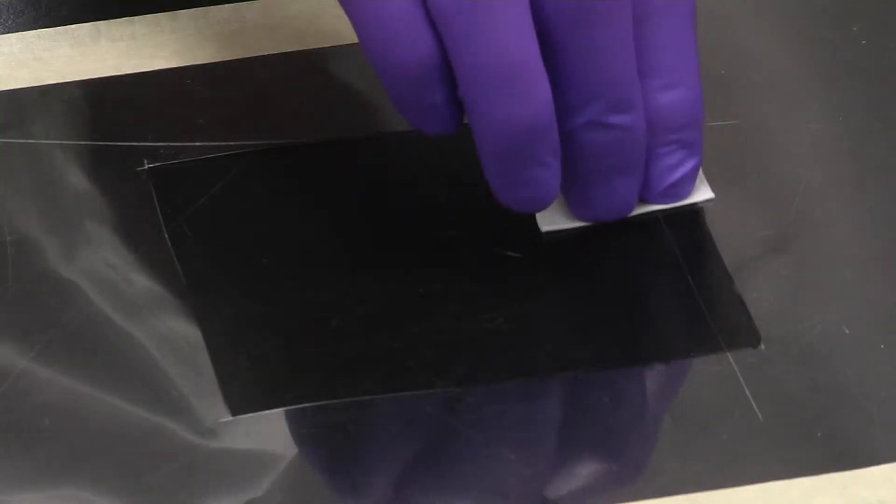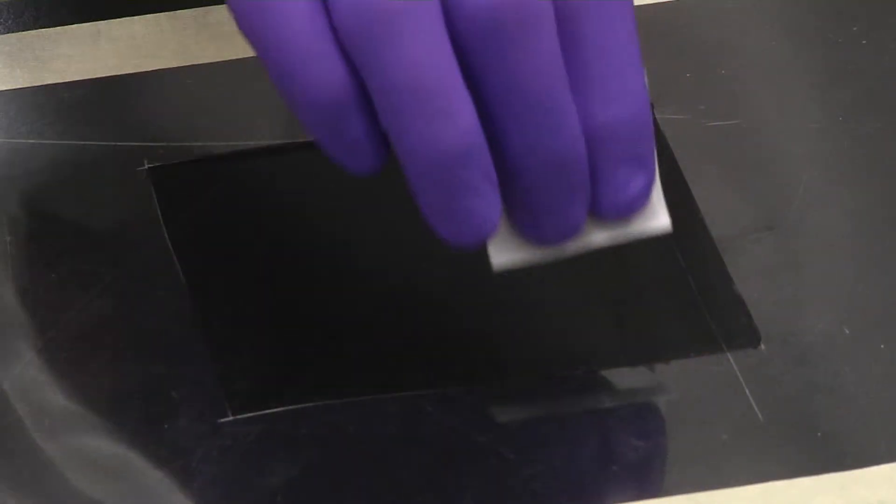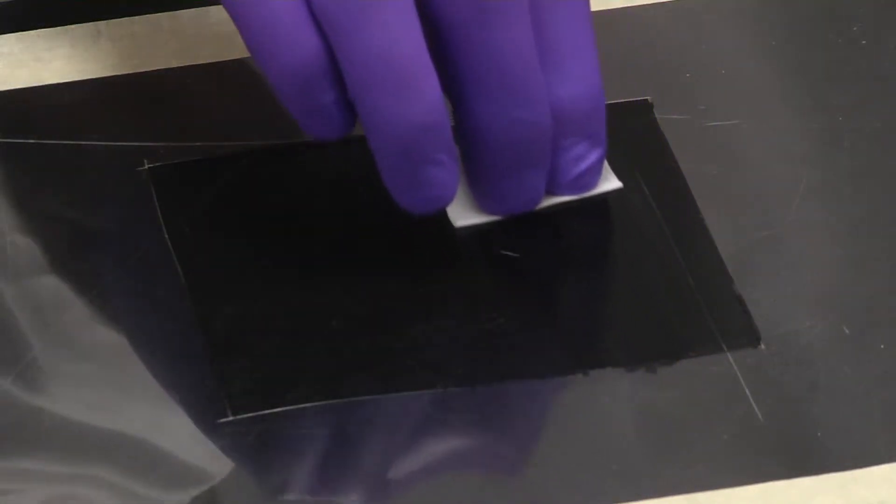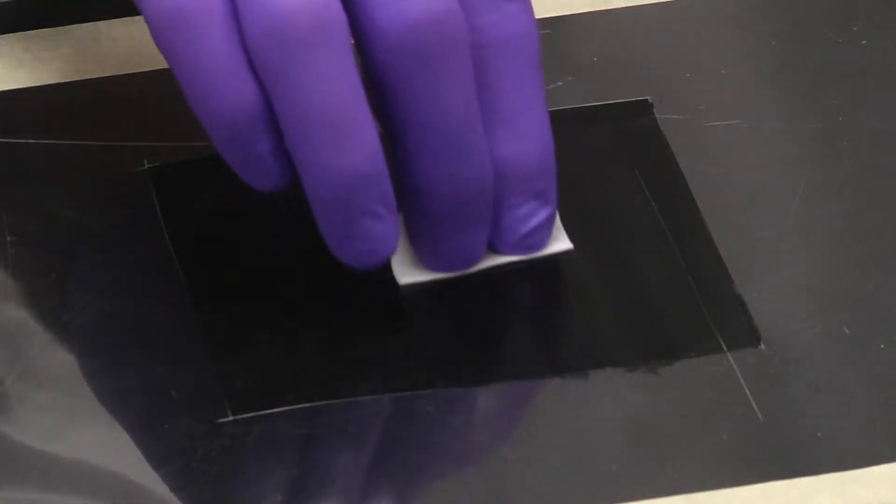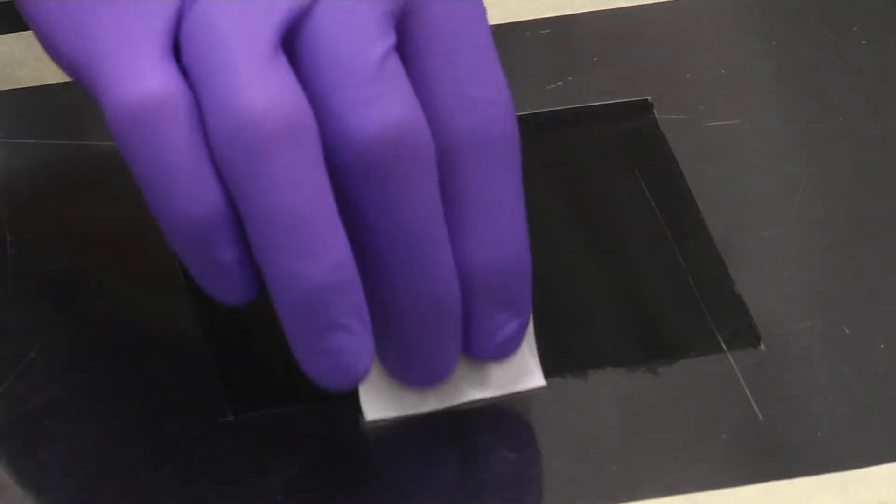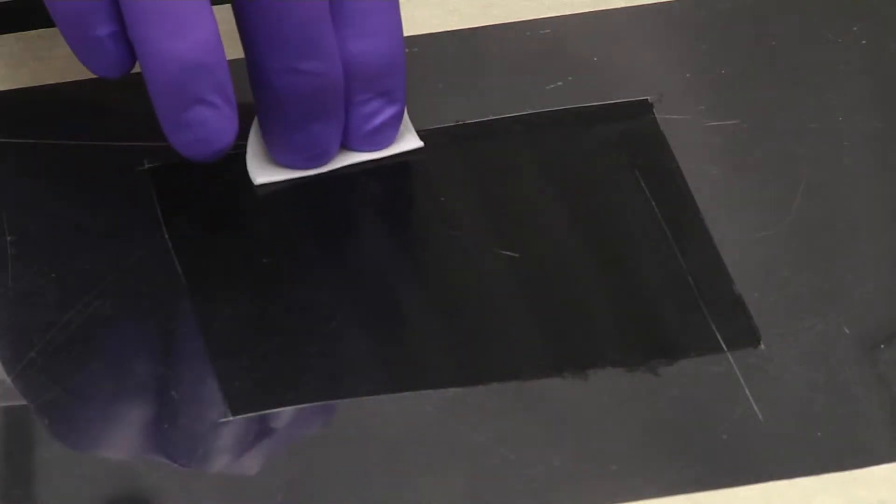Wipe the surface from top to bottom, progressing from left to right. Apply pressure evenly and wipe carefully. If you see any fraying of the wipe or particulate from the wipe left on the surface, you're applying too much pressure.